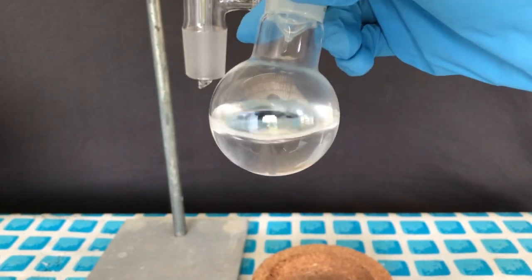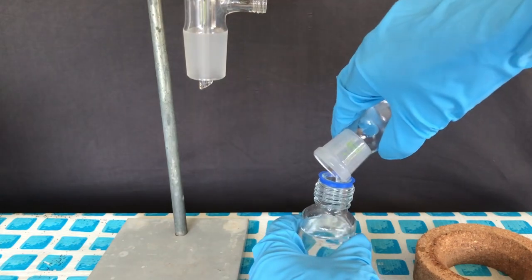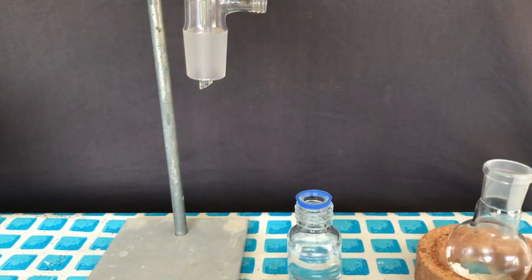The benzyl chloride was carefully transferred to a pre-weighed tight sealing storage bottle. In total, 50.5 grams of benzyl chloride were collected, which represents a yield of 87.8%.